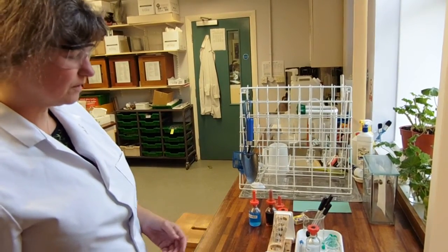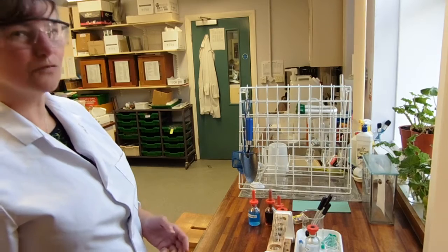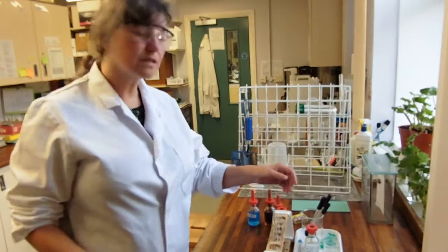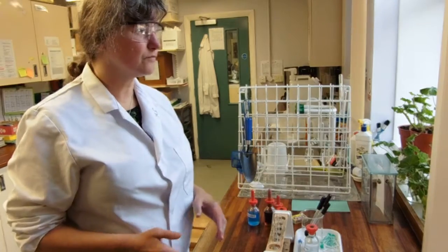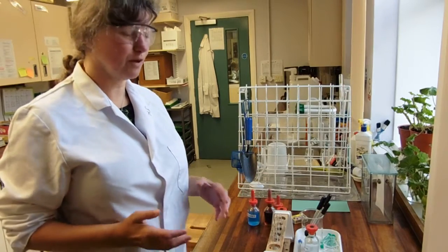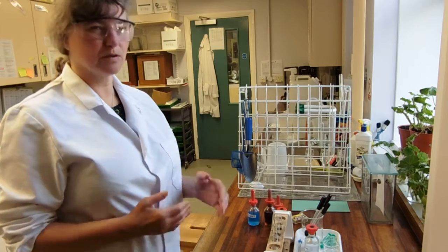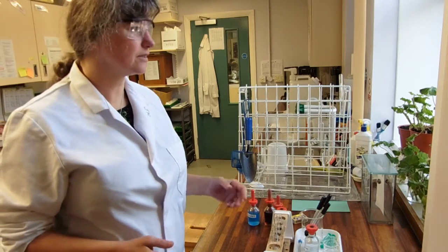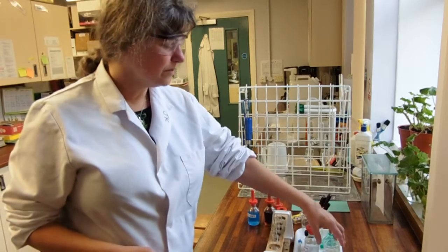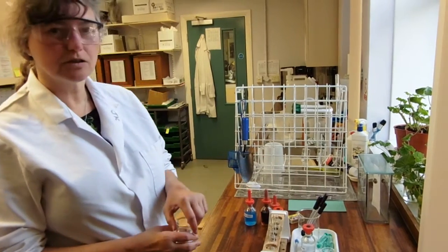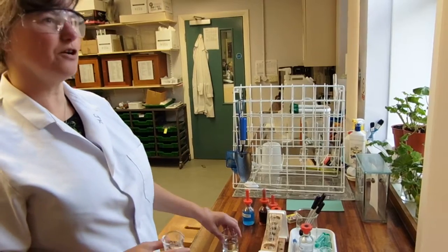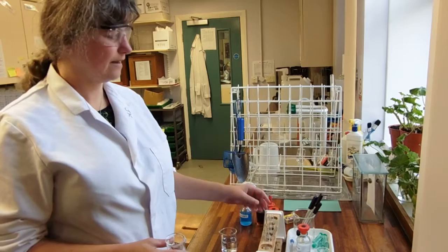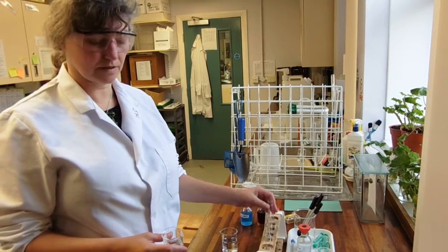Okay, so this is your first practical. It's a practical test for the presence of biological molecules. Sometimes it's called food tests just because your food is made of biological molecules and if somebody wants to know what's in it, they might carry out this series of tests to find out. We've got actually known solutions, so we're not testing food, we're testing things that we know already are there, just to demonstrate what the positive results are.